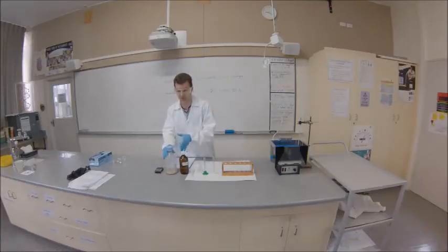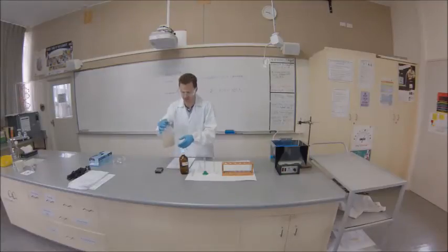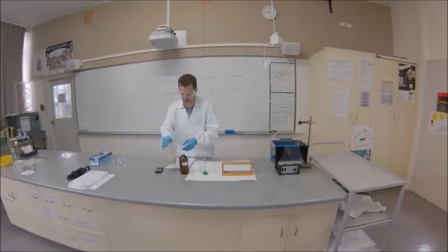It's important before you pour out the yeast that you agitate or shake the container, because the yeast will settle to the bottom. This ensures you're getting the right amount.